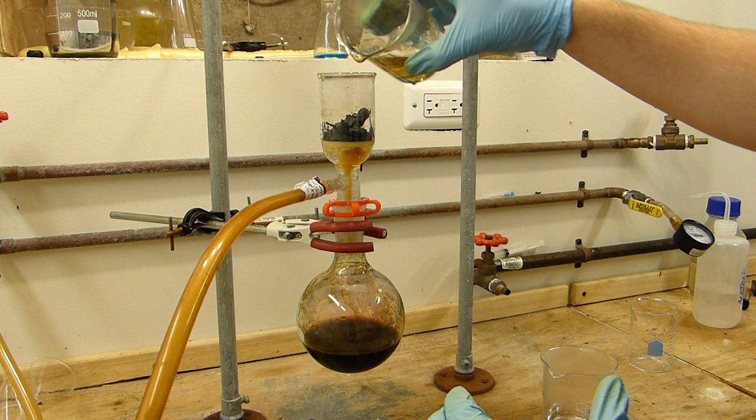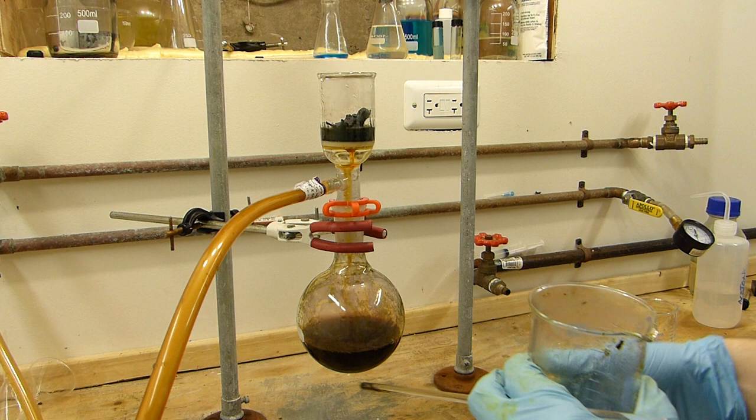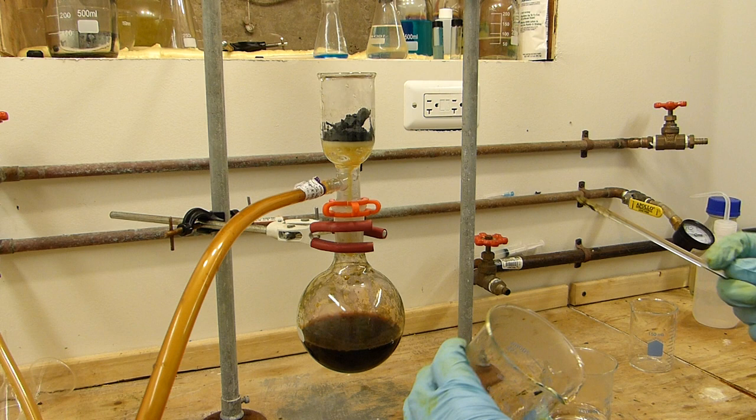It's also serving to cool the iodine down which reduces sublimation considerably. Okay and the rest of this I will scrape out. Oh actually there's really almost nothing left. Okay.